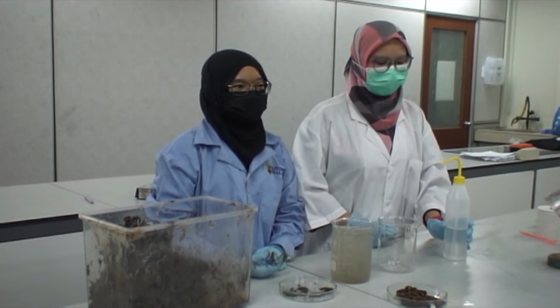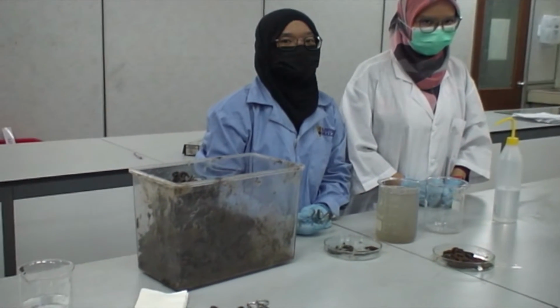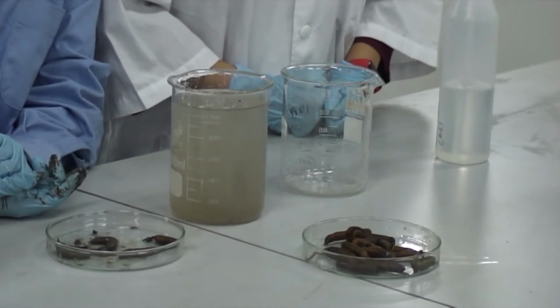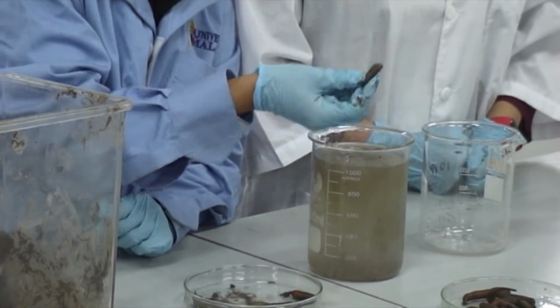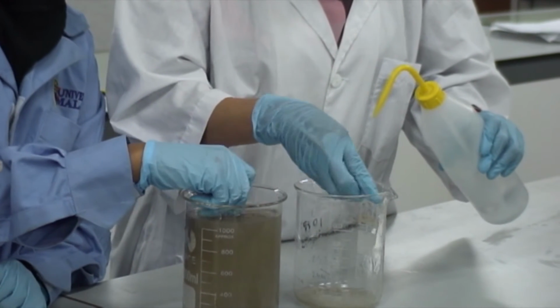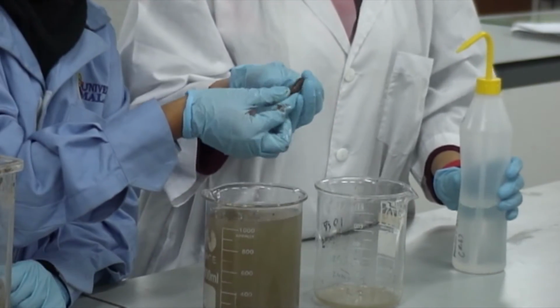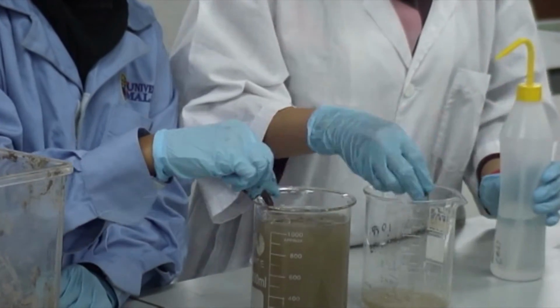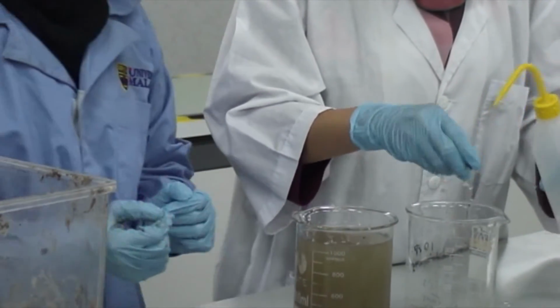Okay guys, so this is what we are going to do for part 1 of this practical, and the objective is to study the ability of the peanut worm to regulate its ionic content in various seawater salinities. The first step is to wash the worm with distilled water and dry the animal gently with lab tissue. For this practical, we need 12 peanut worms, because for each beaker, each level of water salinity, we will use 3 animals. After we have washed all the peanut worms, we need to weigh the animals using the top pan balance.